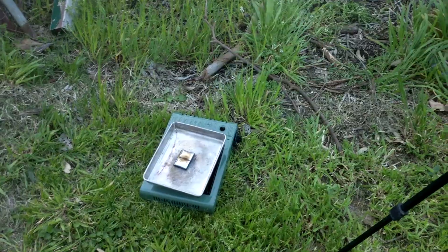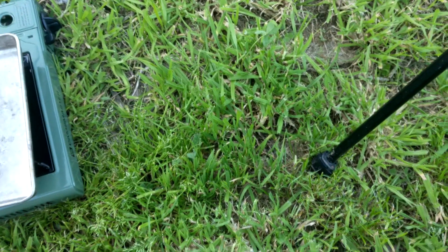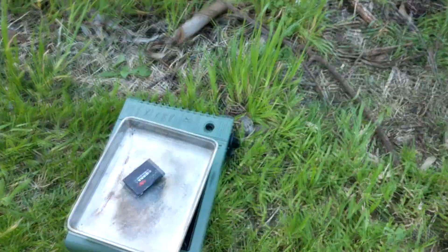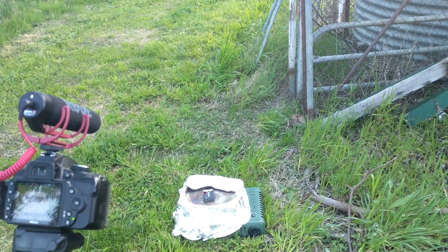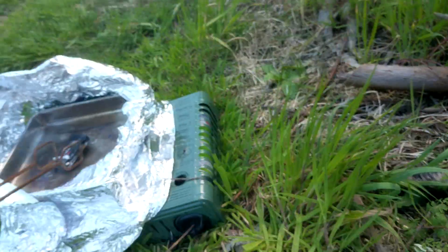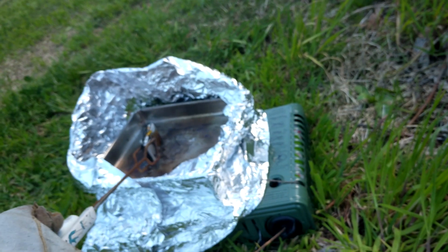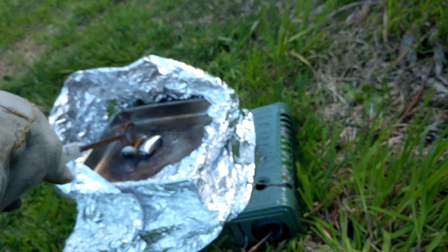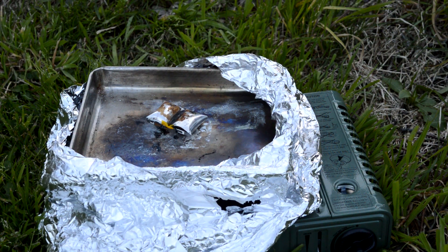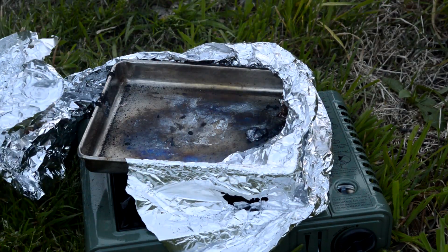I've attempted to move out of the wind a little bit because it was just not heating up very well. There was a metal plate on the back which I took off — we can see that's where all the stuff is inside. So I'm going to flip it back over and crank up the heating, and hopefully this time something actually happens. That was one cell.